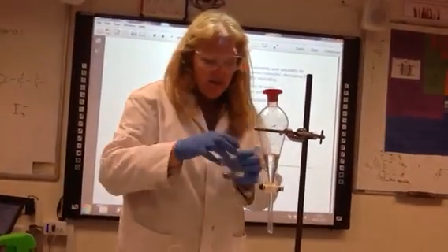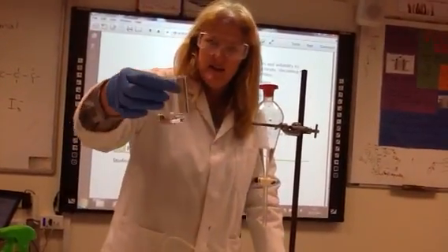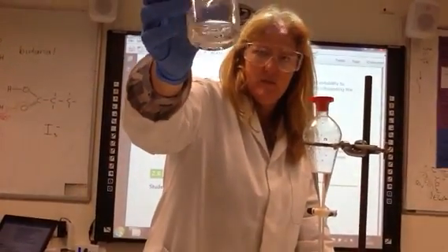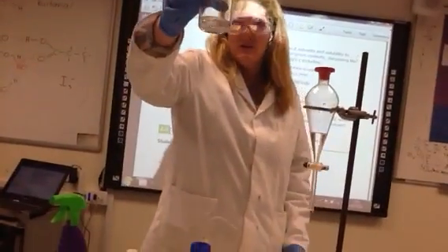And also you have here, just like we did before, we've got some iodine. You can see that solid sitting in some water. So we said the iodine didn't dissolve in the water.